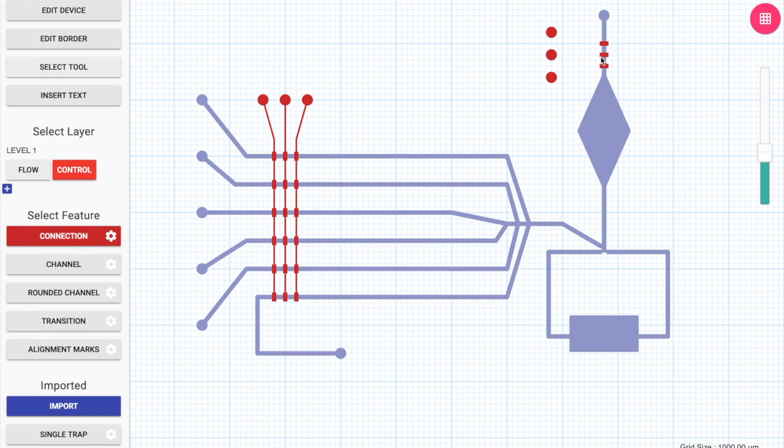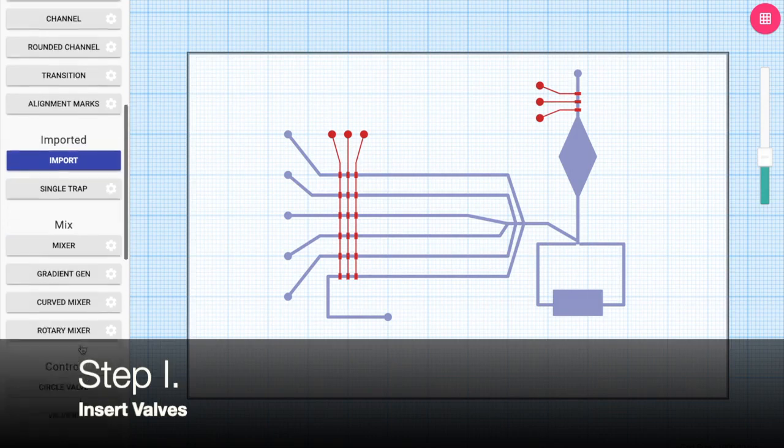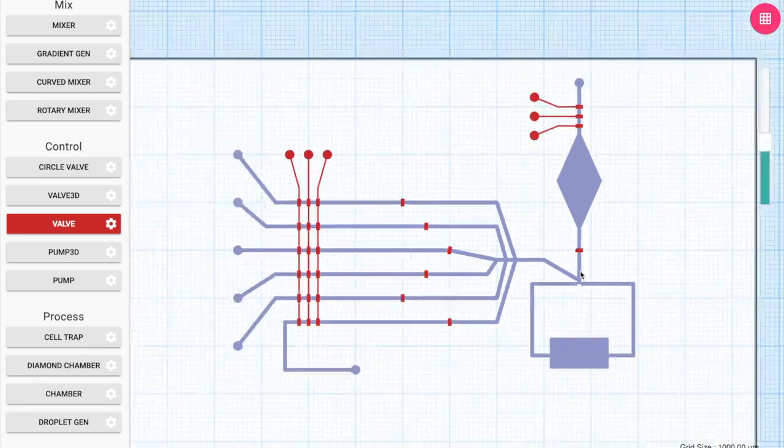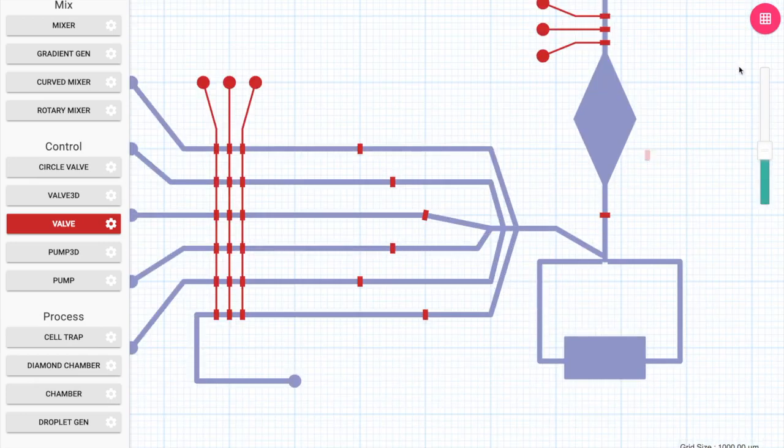So this time, before making the other pump connections, I preemptively made all the changes. Now I'm going to place the valves. By using the valve tool, I don't really have to do much other than just make sure I'm placing the valve on a connection. By placing a valve on a connection, the valve tool will automatically orient and readjust the valve to ensure that it is on the connection. In the case of valve 3D, as you can see on the left toolbar, it will also redraw the connection so as to account for the break using the particular valves which we use over there.